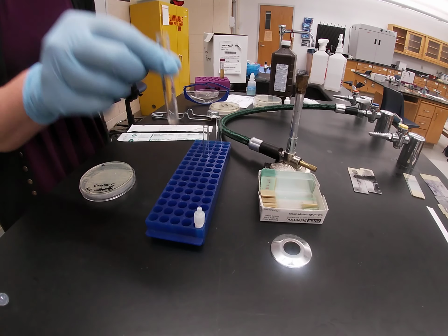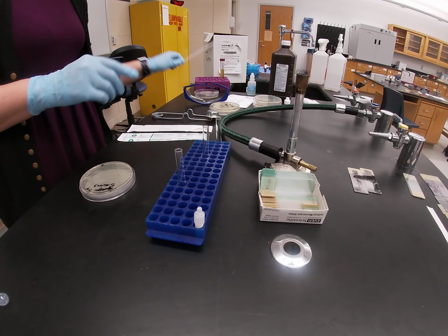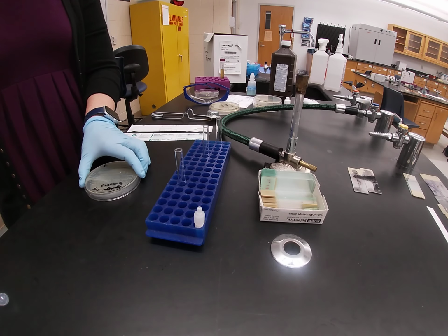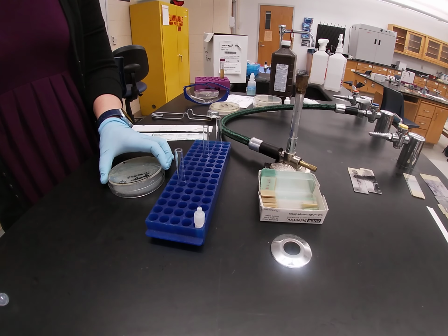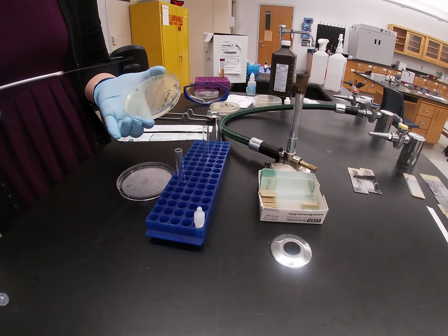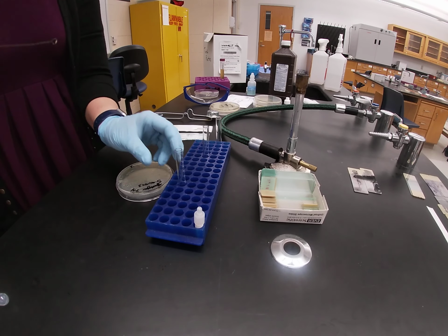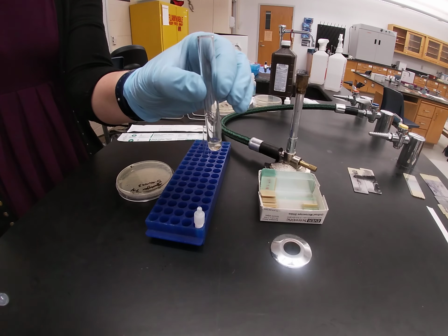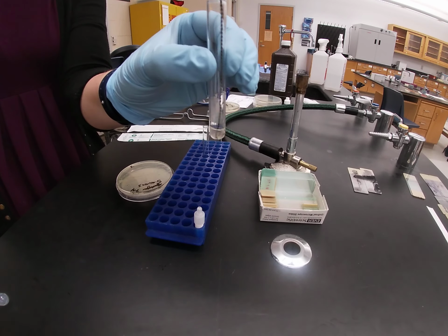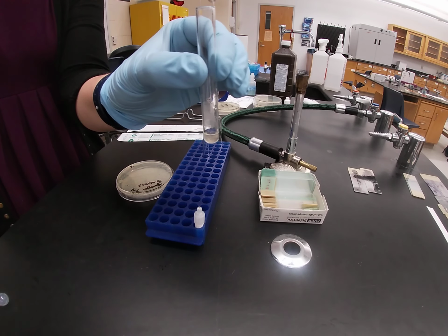After you have your coagulase reagent in a test tube, you are then going to take your loop, incinerate, and then you are going to aseptically pick some bacteria. For a coagulase test, you want to take a loop full of bacteria. You want a good representative sample. And then you are going to mix that directly into the rabbit plasma. Mix it really well. You want to try to break up any clumps. Really let it get well mixed.